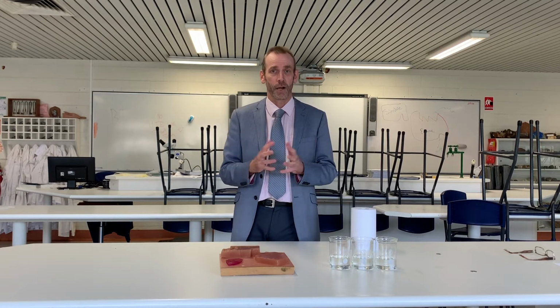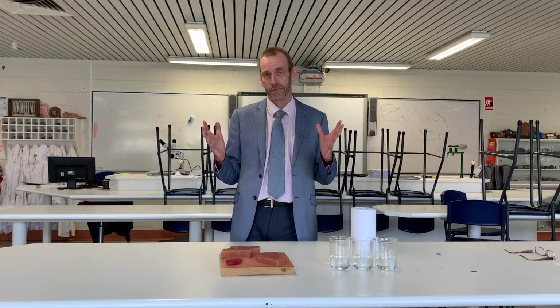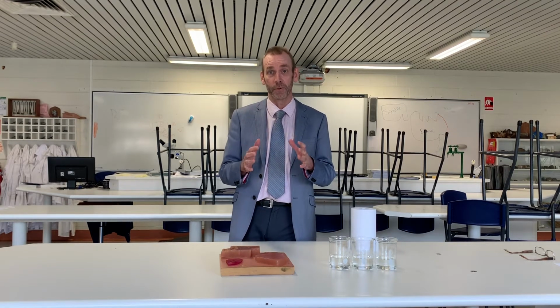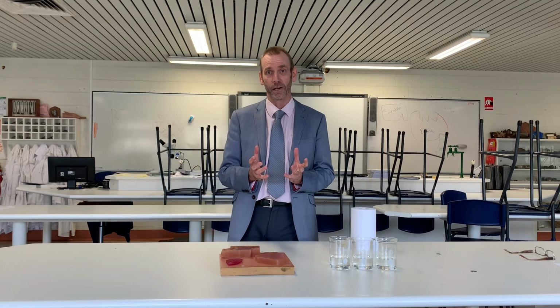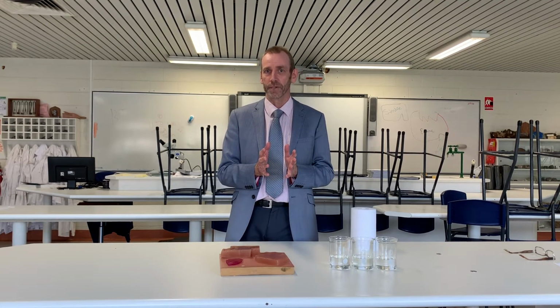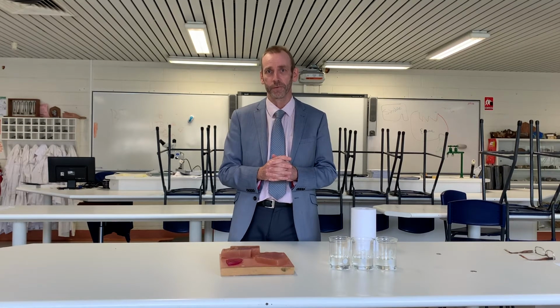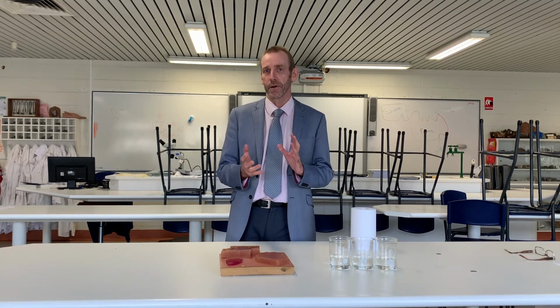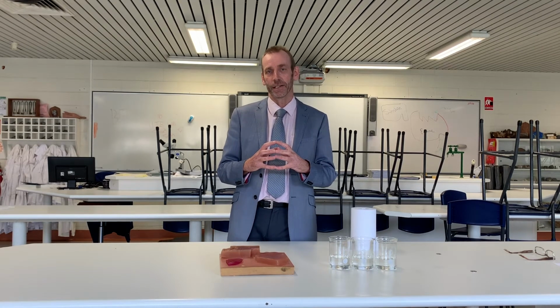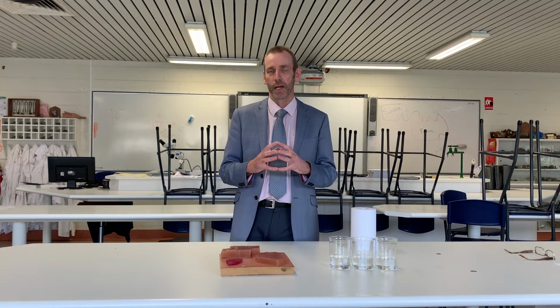So if we just look at oxygen, for example, oxygen has to diffuse from outside the cell into the cell. It does that through the cell membrane, which is the surface area of the cell. And now that oxygen's got to diffuse all the way to where it's needed within the cell volume. So we have an interesting problem here where the surface area actually has to feed the volume. And what we're going to do is a little experiment that looks at how this is changed by cell size.